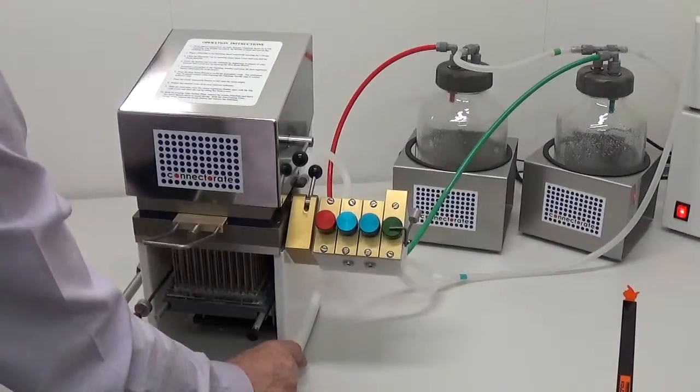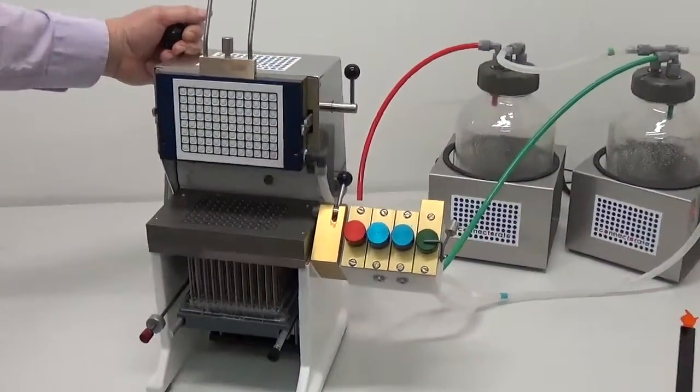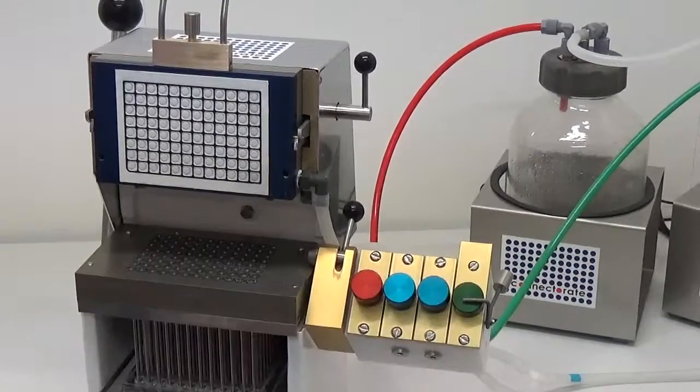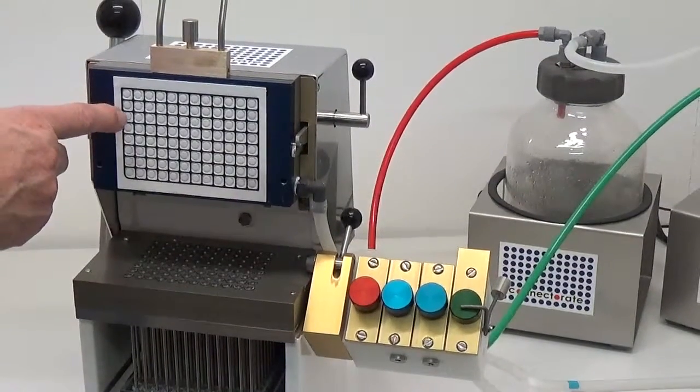In the procedure you open the harvester. To keep the green valve activated, it will dry down the filter.